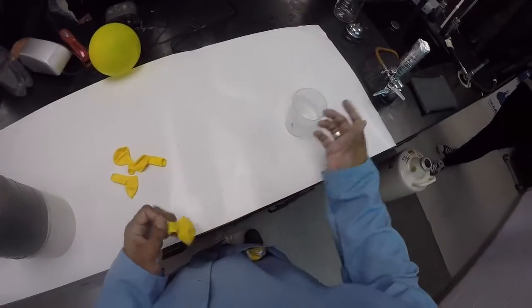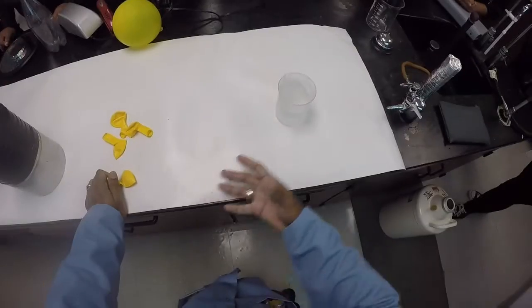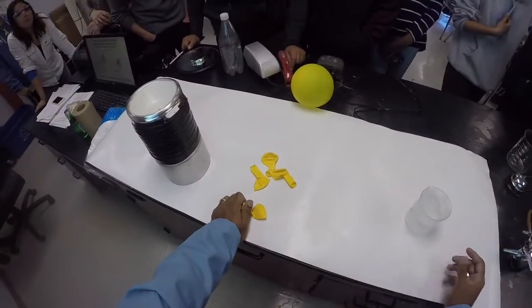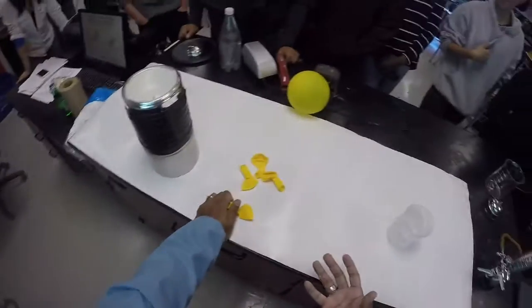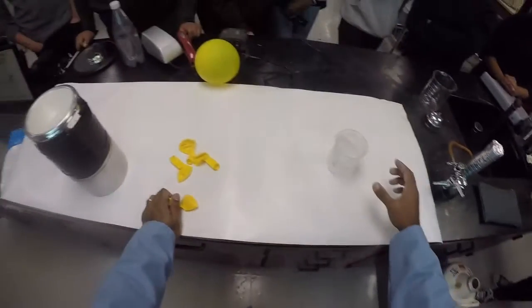Pretty much, right? Because basically what it does is it creates a layer of air that causes it to kind of float above the surface of anything that it's on. It literally creates a layer of gas that just floats on, almost like a hovercraft or something like that. So I can just pour it on there, and it's really nothing. I can pour it in your hand.